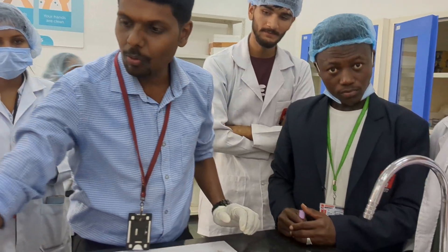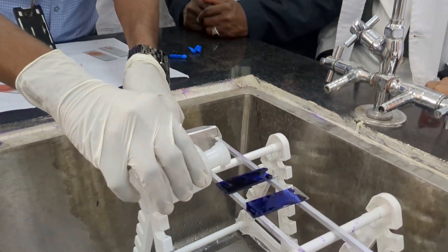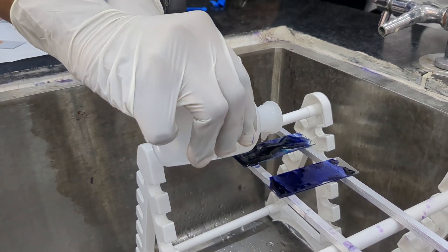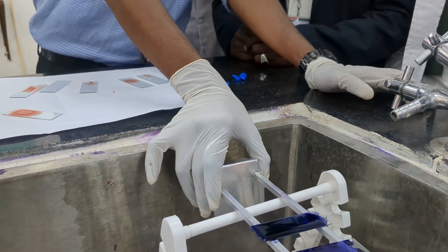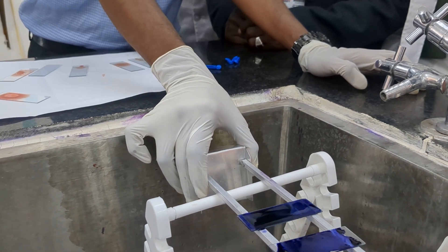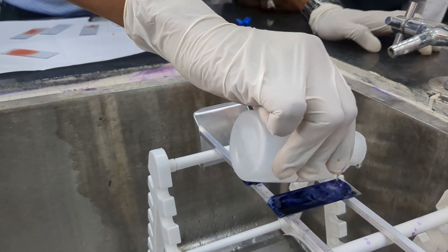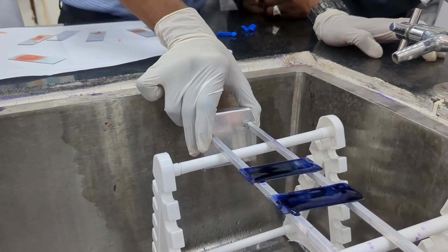The two minutes has been completed. Now we need to add distilled water gently from the head portion onwards. Add a few drops of distilled water and let it mix. You can mix the slide by gently agitating. We have taken two slides here — let me mix the other one also, and gently mix them.